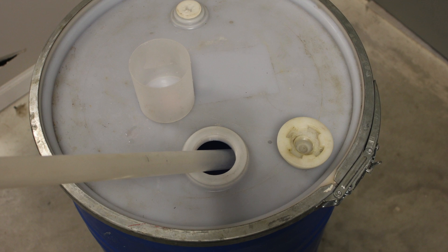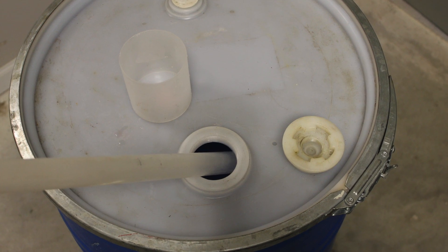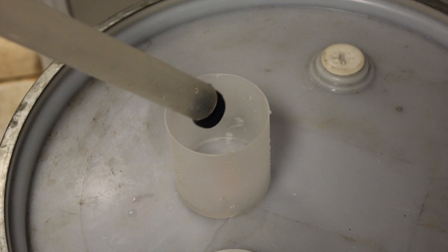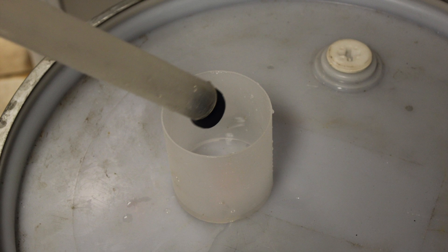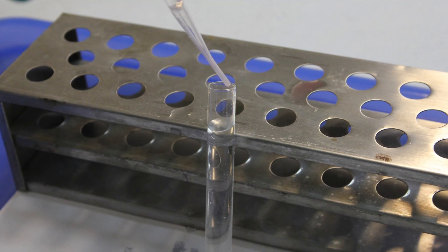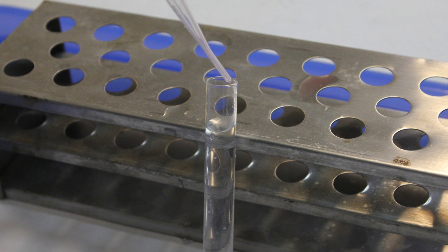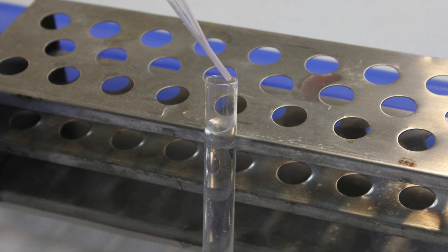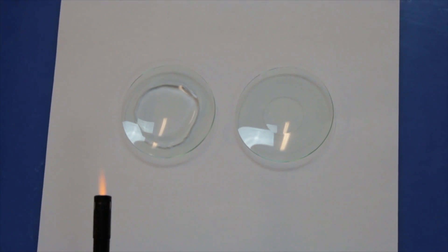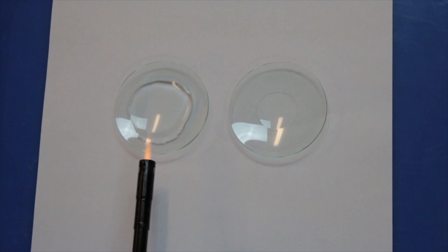So if you're testing from an unknown drum, a plastic sampling tube is used to remove a small amount of the product. Use a pipette to drop a dime-sized amount onto the watch glass. A match is then used to test for flammability.